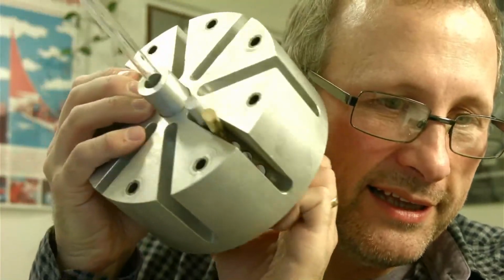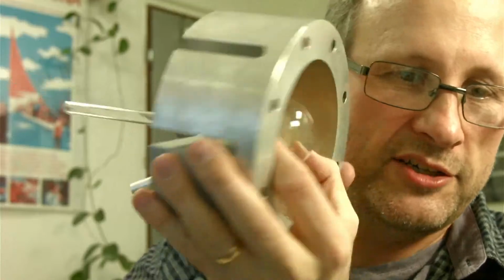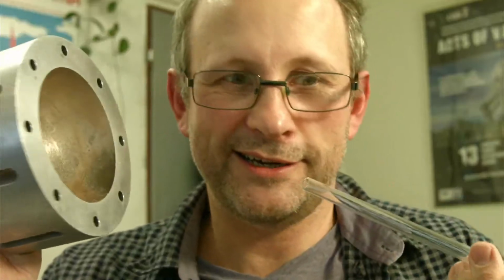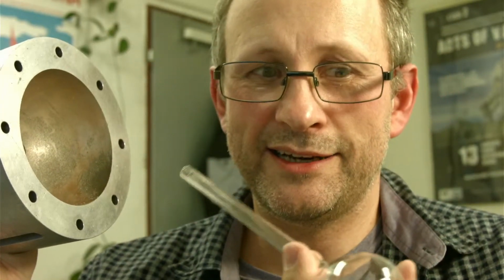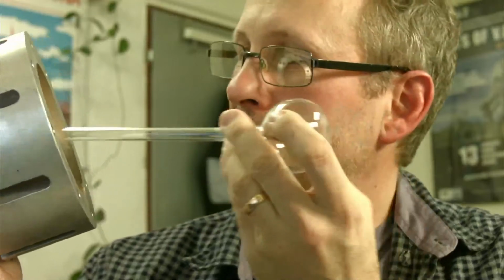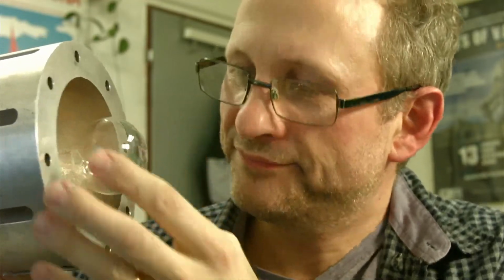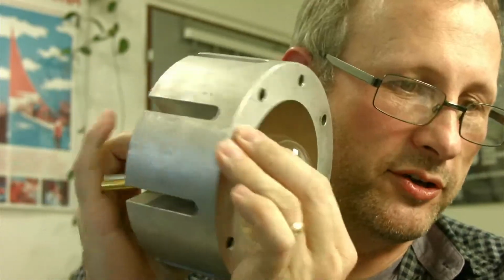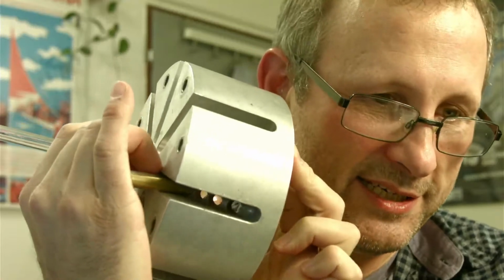The problem I was having was really getting a solution that would be able to look through these holes in the reactor, these holes down here, to see the reaction chamber inside. And you know what, I'll actually be quite glad to finish this experiment, because having these around the lab, you get some funny looks. But anyway, the reaction's going on in here, and we want to be able to look through these holes here to the reaction chamber and see if there are any changes in spectral lines.